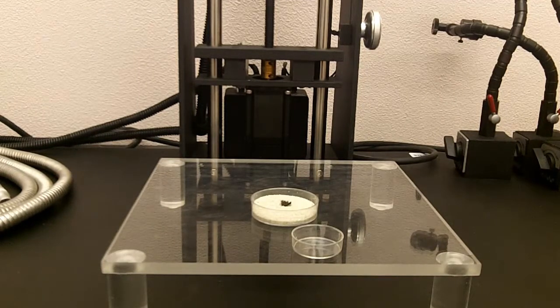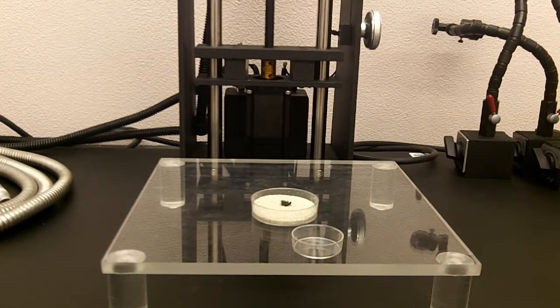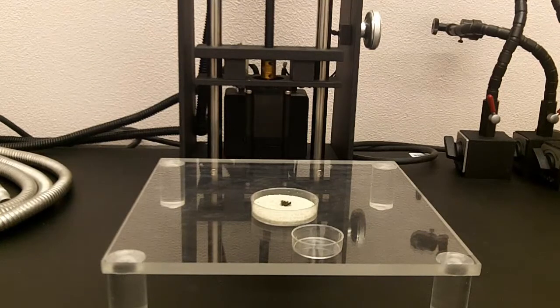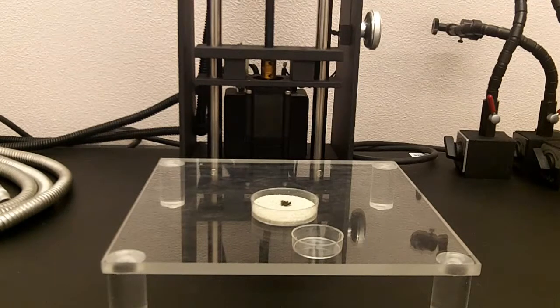A reason to use the gel technique is it can create a nicer, more even background. And sometimes with a sand specimen, when you bury it to situate it, it can hide parts of the specimen's body that you may otherwise want in the image.